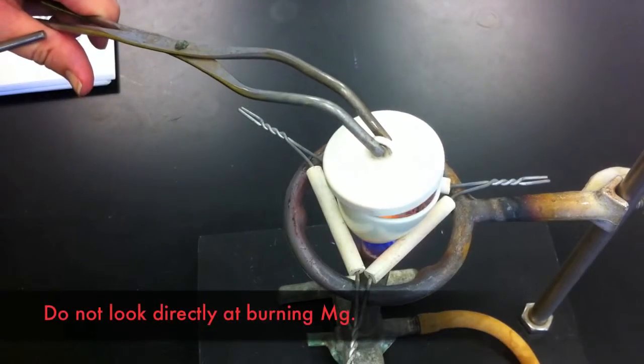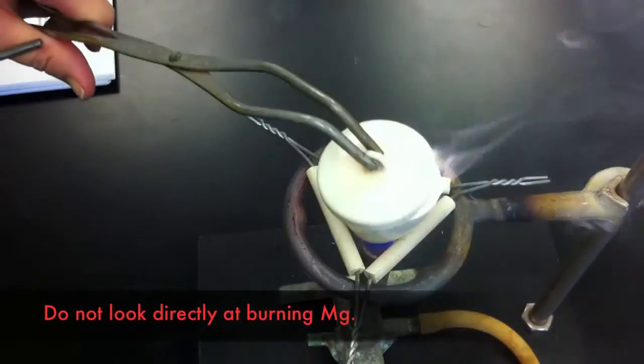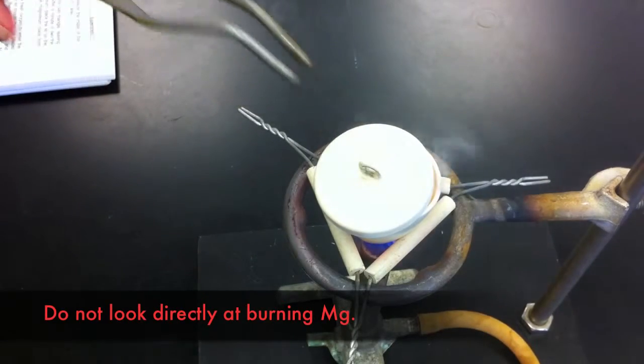Do not look directly at burning magnesium. The intense light can damage your eyes.